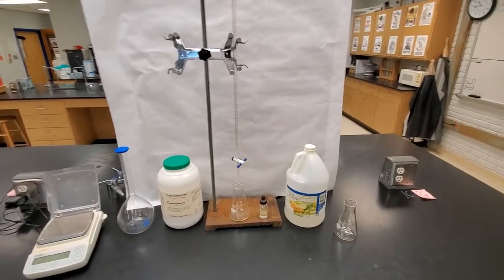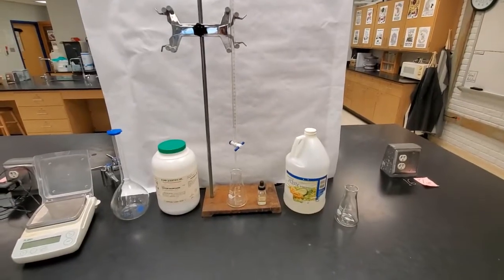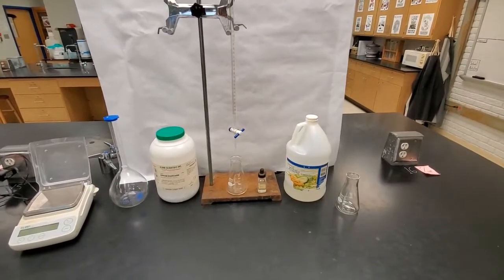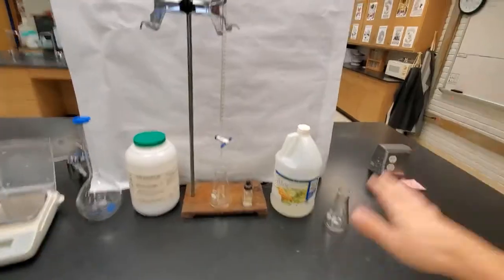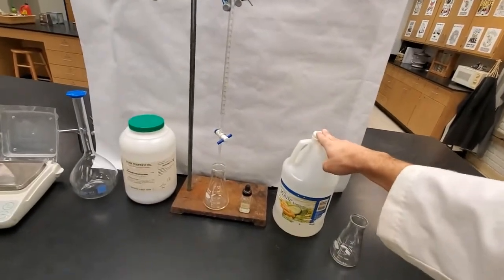So we have a little bit of vinegar here and we are going to see is this vinegar 5% acetic acid like it claims to be. So this is sort of our unknown concentration. We are trying to determine the concentration of our acetic acid in this.